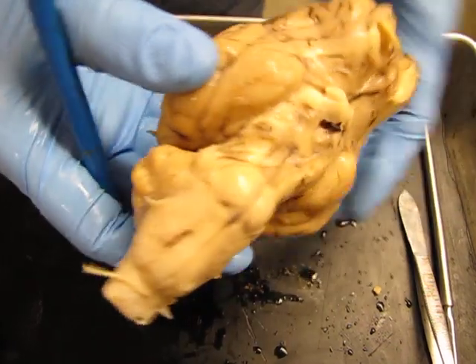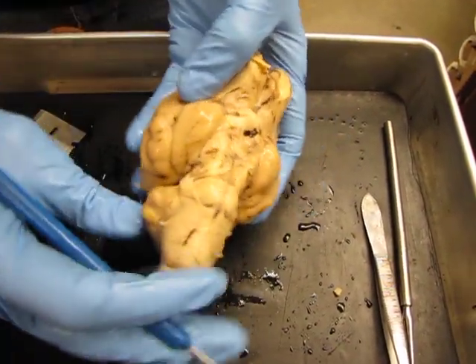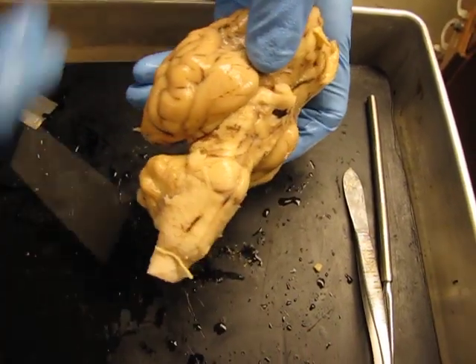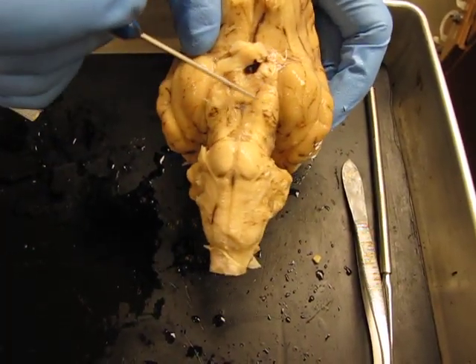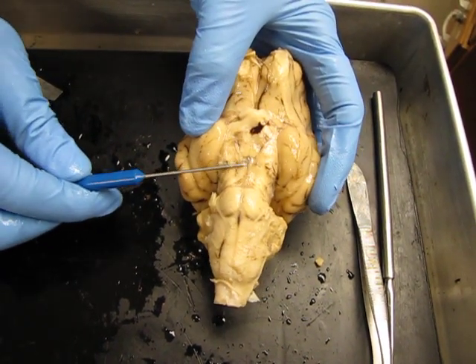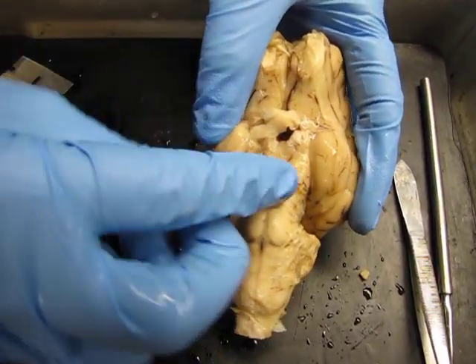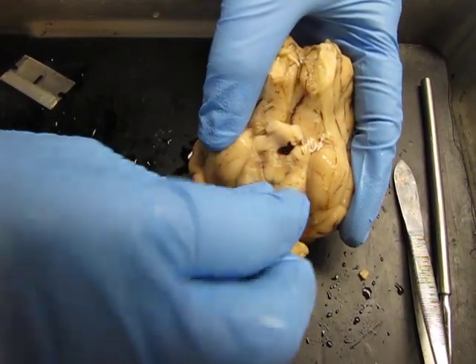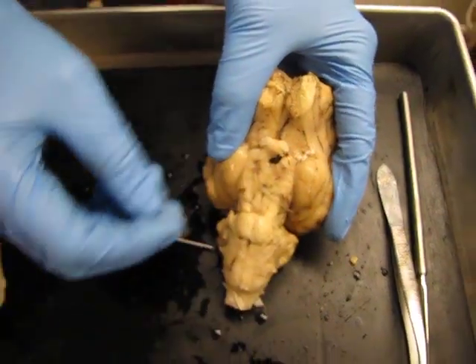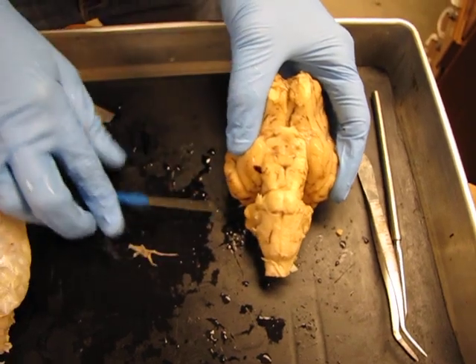If we flip the brain over, we can see the bottom of that same part of the brain. If you look at it there and then roll it around, you can see that this part is the bottom of that area called the midbrain. Now there's still some pia mater attached — you can see this thin layer of tissue in close contact with the brain. If you peel some of that back, some of the blood vessels will come with it, and you can see those parts of the brain a little bit better.